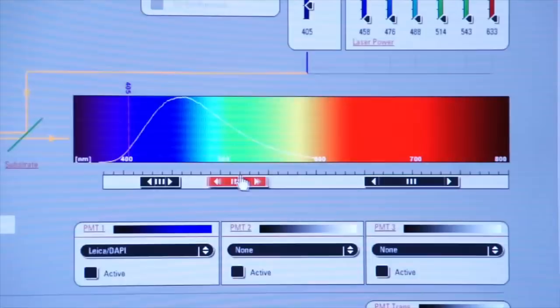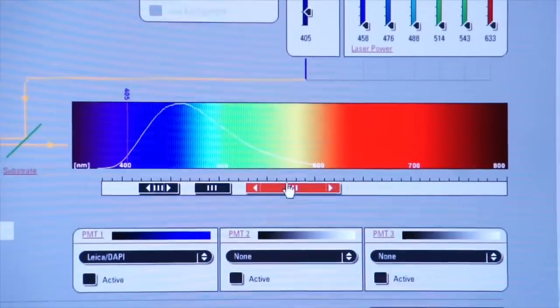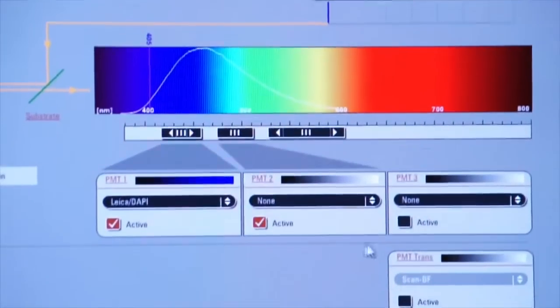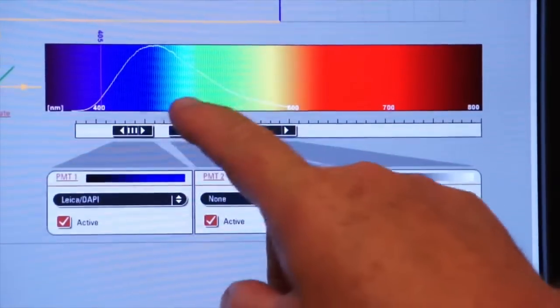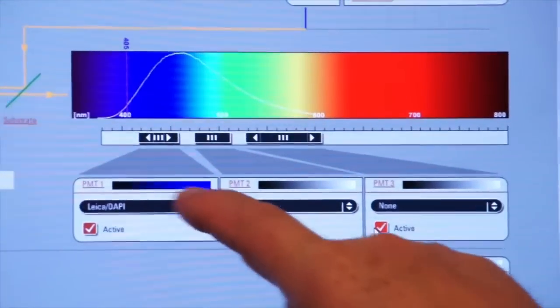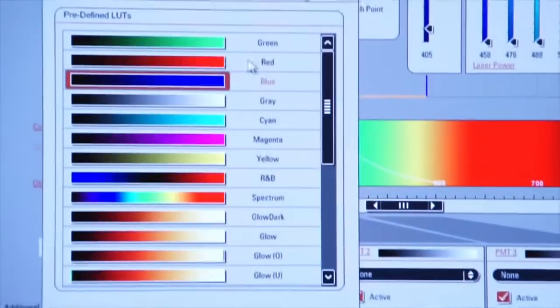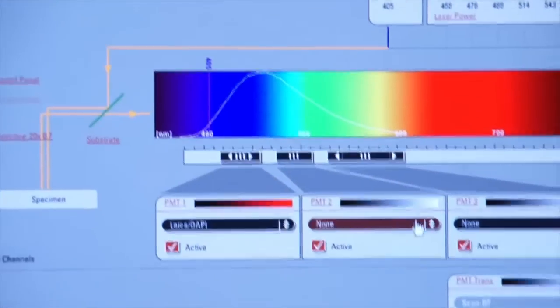In fact, I can do several photomultiplier tubes if I wish under one particular spectra. So now I have 3 photomultiplier tubes engaged that are selecting light, different colored light from underneath the emission spectra. I can also control the output color of my photomultiplier tube. For example, this one is set to blue, but I can set that one to red or any color that I like. So we'll make that one red.